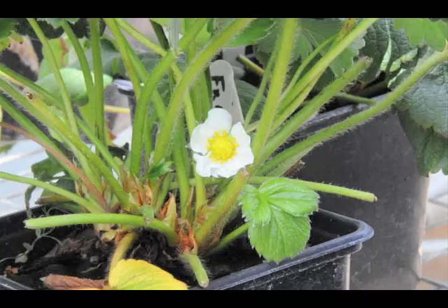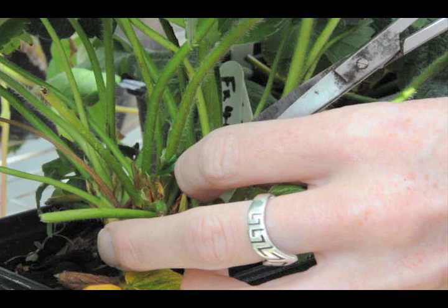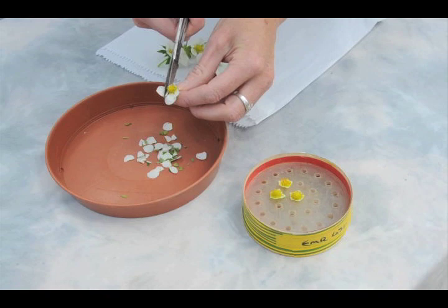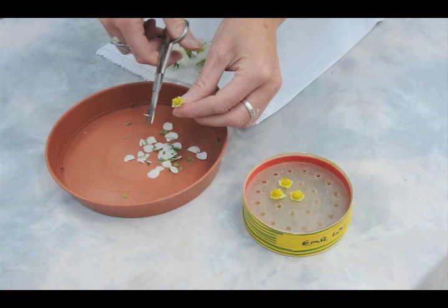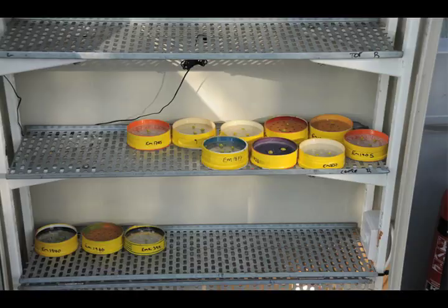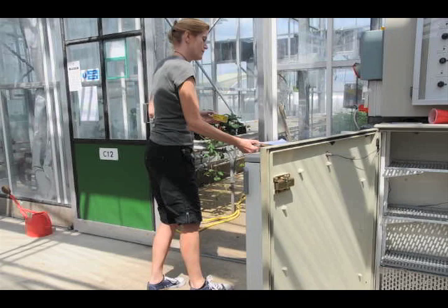The flowers from the other chosen plant are removed and put into a specially prepared dish, which is labelled with the crossing number of the strawberry plant. The petals are then cut off the flower to make it easier to see the stamen. The labelled dishes are then placed in a heated cabinet for a few hours to allow the anthers to dehisce and release their pollen.